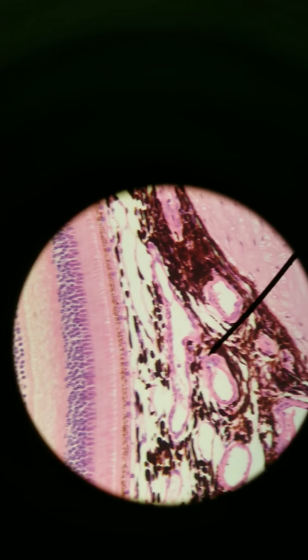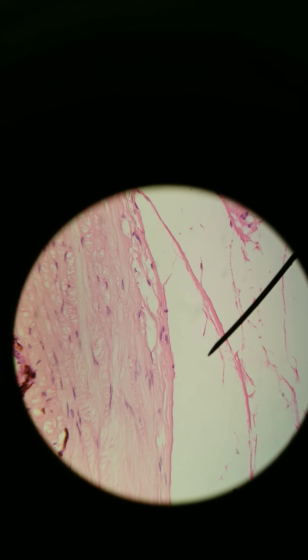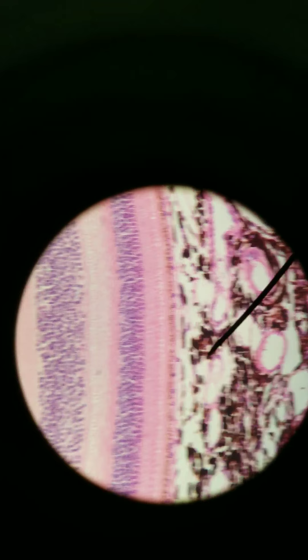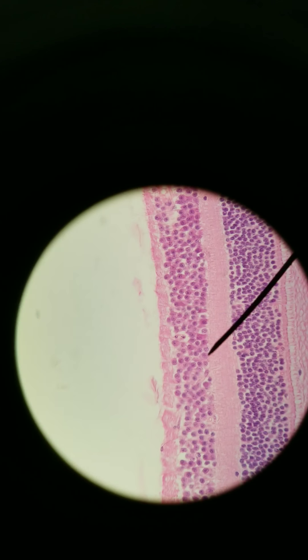This is the choroid tunic, the choroid layer — you can see all these blood vessels. And then the outer portion is the sclera, the protective fibrous area. So you've got the protective fibrous tunic, the choroid tunic, and then the retina — these layers of three cells — is the retina.